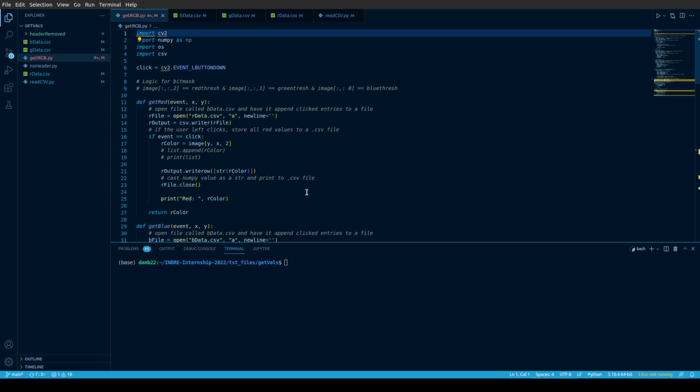Hello everyone, this is Dan Blanchette, and we are taking a look at a work in progress here, which is my cell calibration program. This is going to set a threshold based on researcher inputs. Whatever images you have, whatever color range you're working with, we're going to take a few samples from whatever image you're doing research on, and average those values for that color channel. That will then be applied to the cell counter program, which will allow your cells to be recognized by the computer. So here's what we have so far.